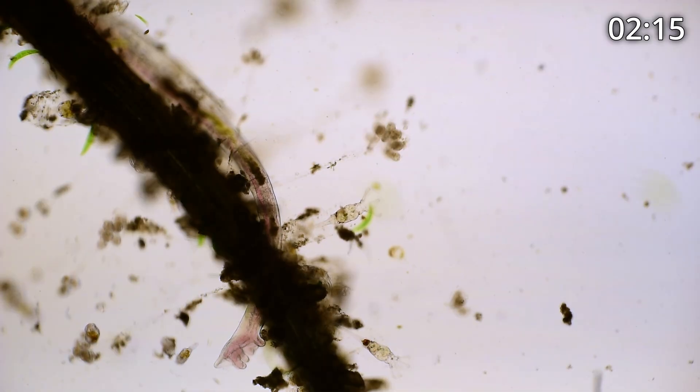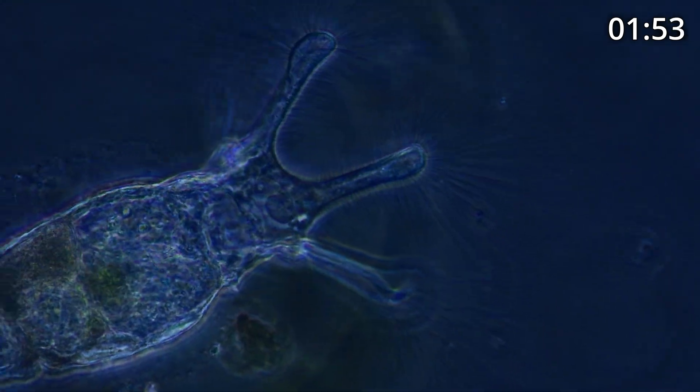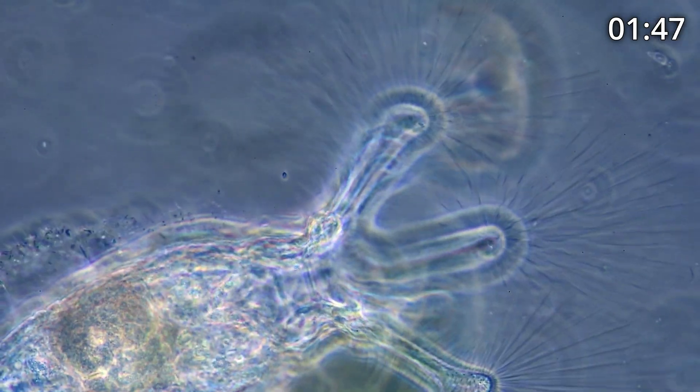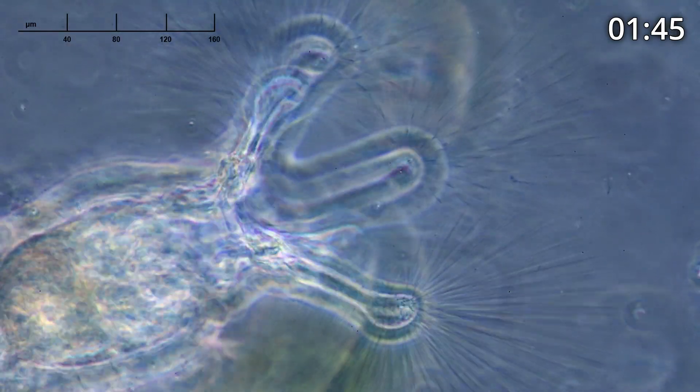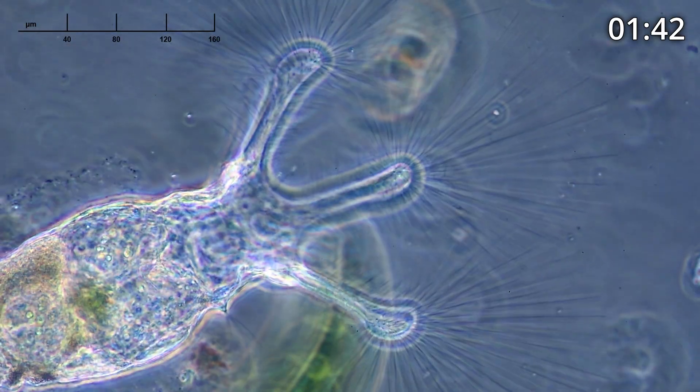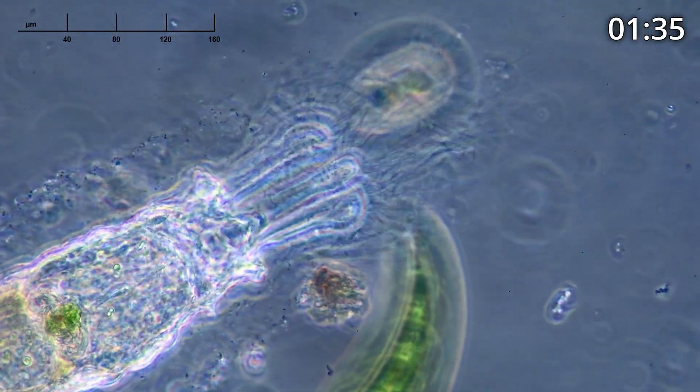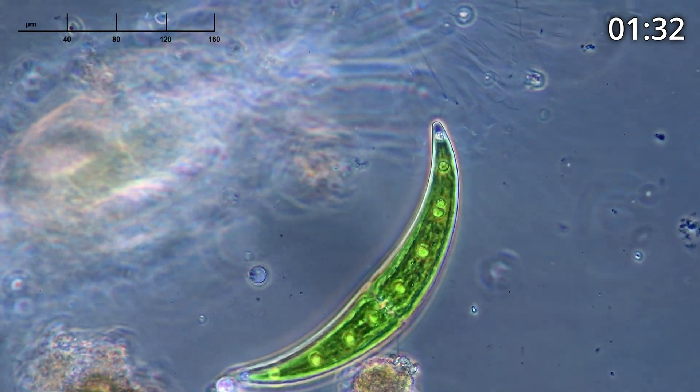There are actually a couple more colotheca — I think these are the original ones. I'm going to try taking a look at higher magnification using a type of lighting called phase contrast, and if we're lucky we'll be able to see these beautiful hairs in inverted colors. Now you can see very nicely the lobes of the corona of the colotheca rotifer and these beautiful hairs — and if you watch, some of them are going to be vibrating. You can see some of them moving and vibrating; that vibration is what attracts food to it.